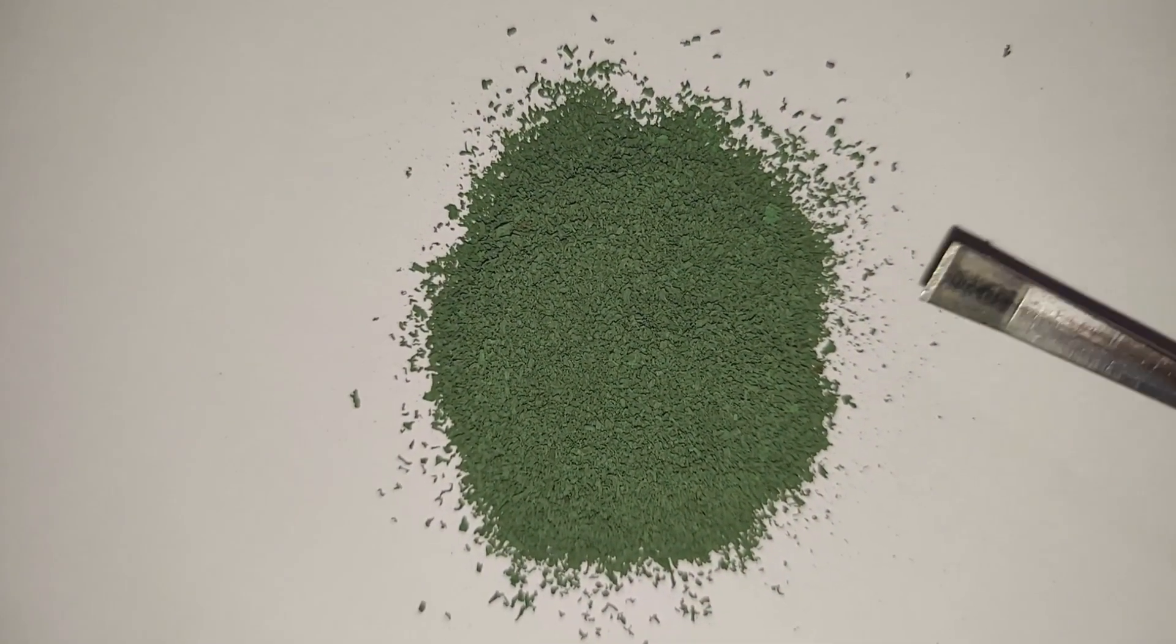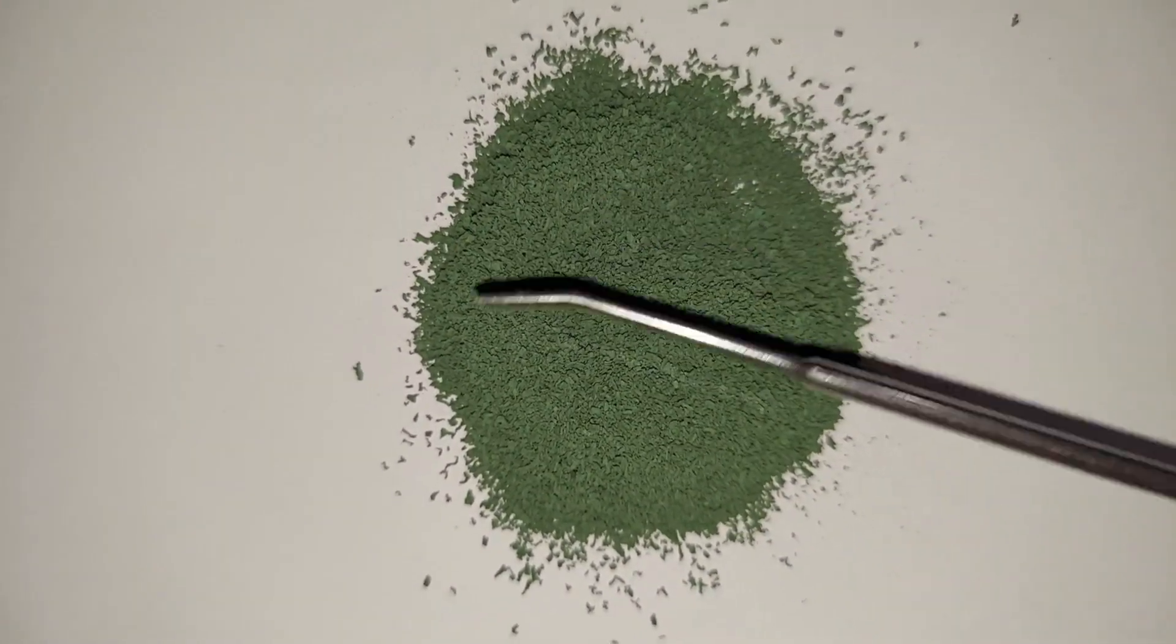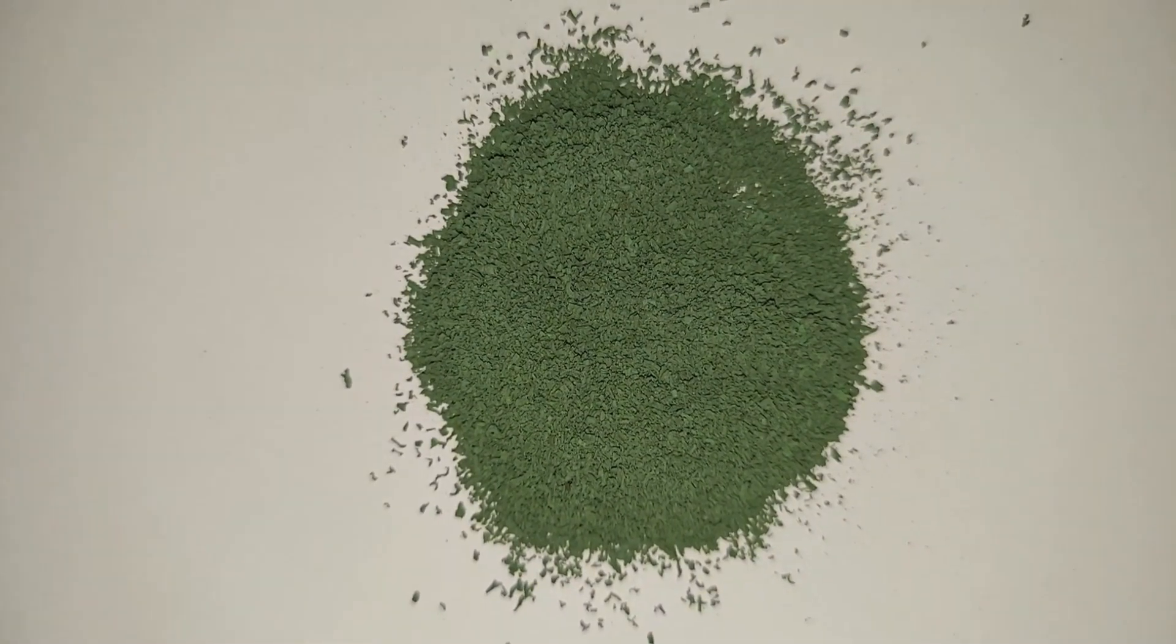This is the chromium oxide we'll be using in this experiment. It's extremely light, obviously green colored, and I got it as anybody will when you burn ammonium dichromate.